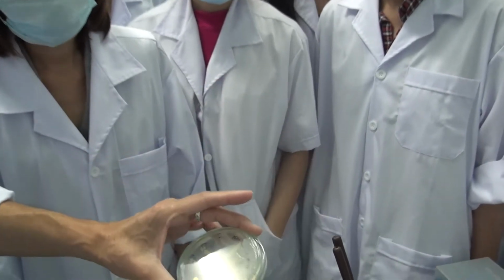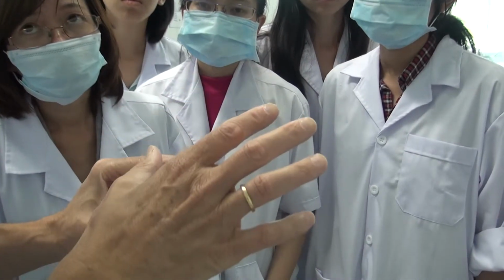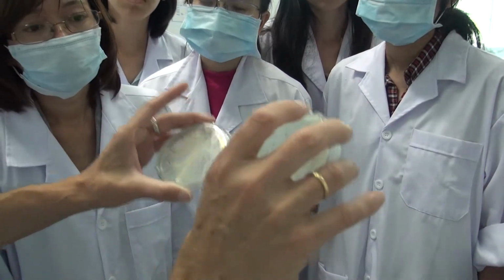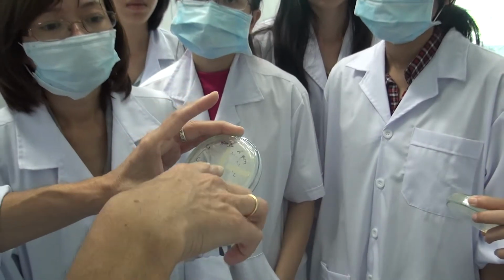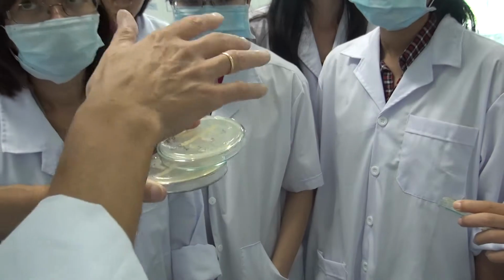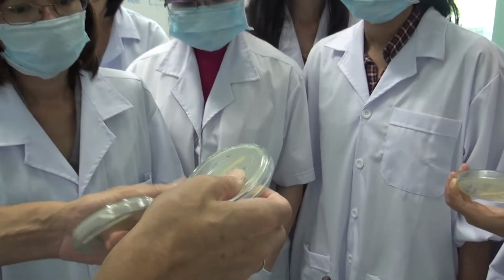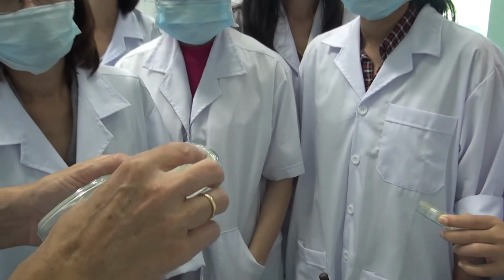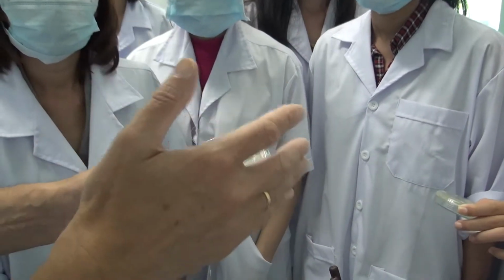But you see that with this very simple technique, if you do it right, and if you look long enough, you can discover interactions. You can discover bacteria which can potentially inhibit others. Now we just took randomly, right? But let's say that you have a bacterium, a pathogen, and you want to find a bacterium which produces antibiotic against this pathogen.